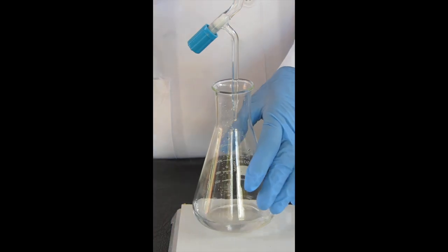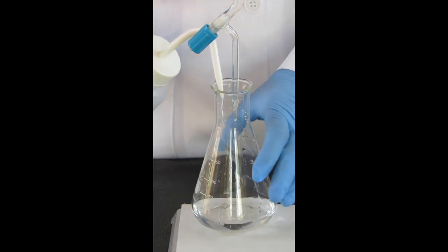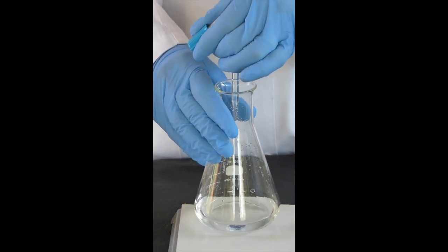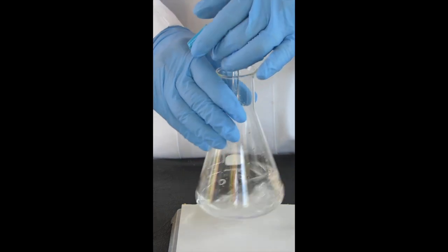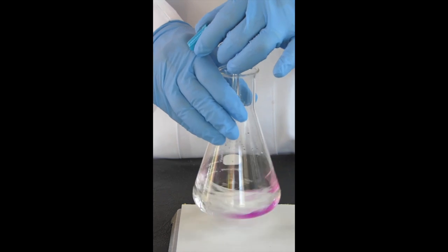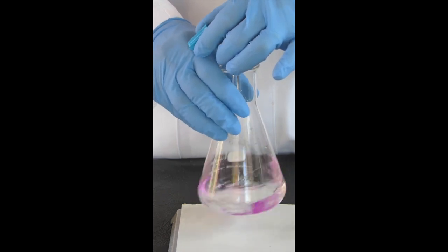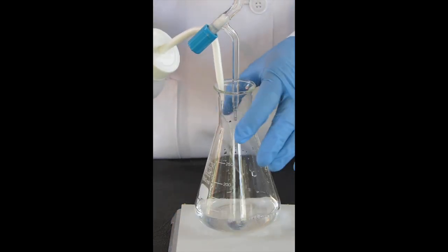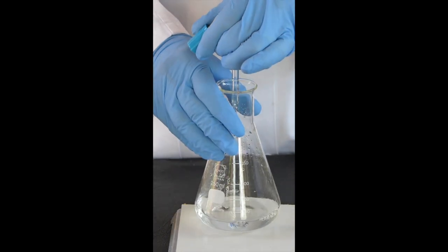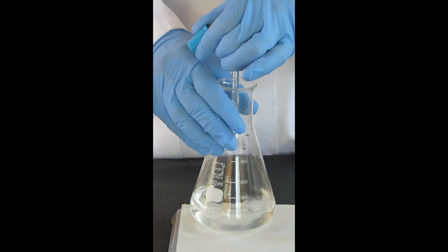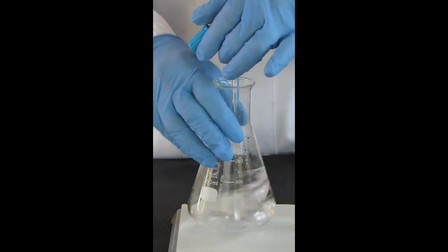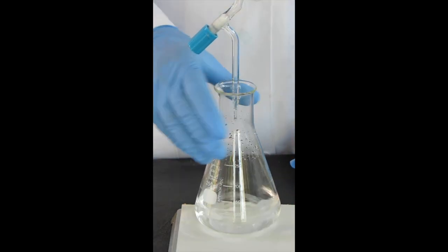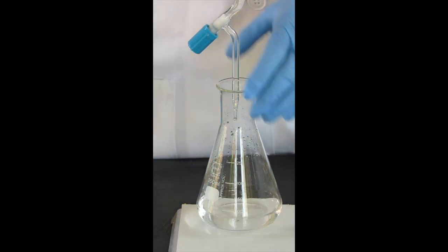Rinse down the walls of the flask. Now I need to go slowly—getting very close now. Again, rinse off that tip. Very close. Rinse again.